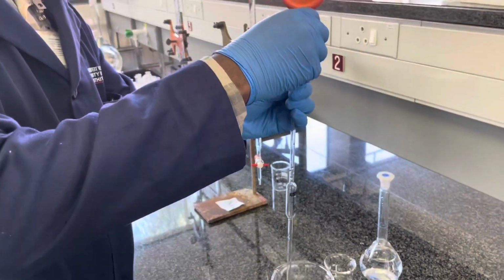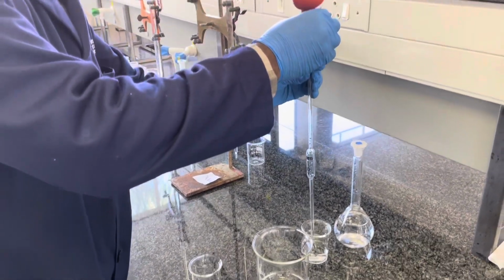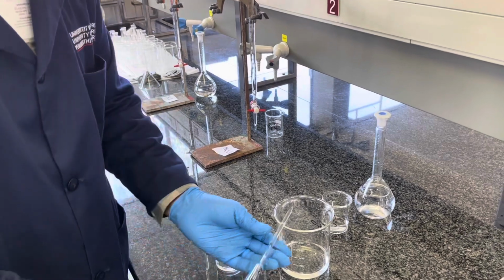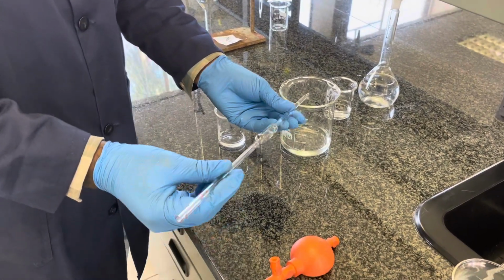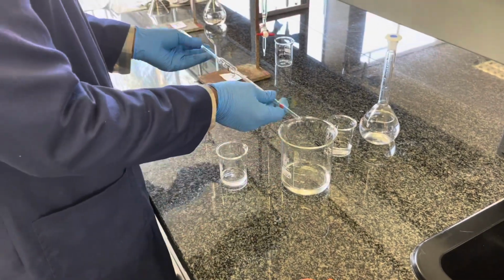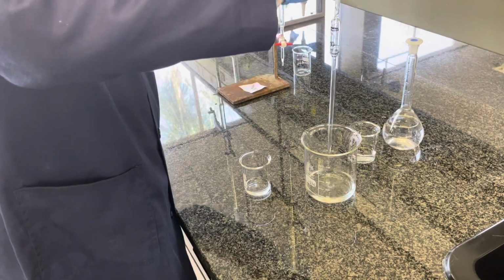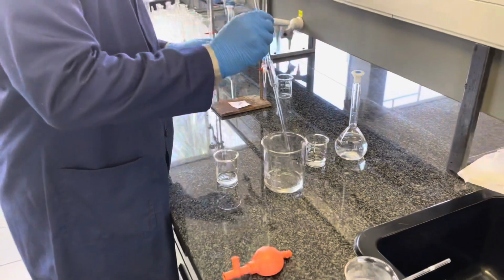With the pipette, it's advised to do this twice since you might easily miss a specific spot on the pipette, and we're working with very small volumes on this, not as much as we worked with in the Buret. So do it for a second time, following the exact same procedure, working with a horizontal pipette, twisting it around in your hands, slightly tilting it to either side, first forwards and then backwards, allowing the solution to drip out of the pipette. Now we are ready to dispense our solution.